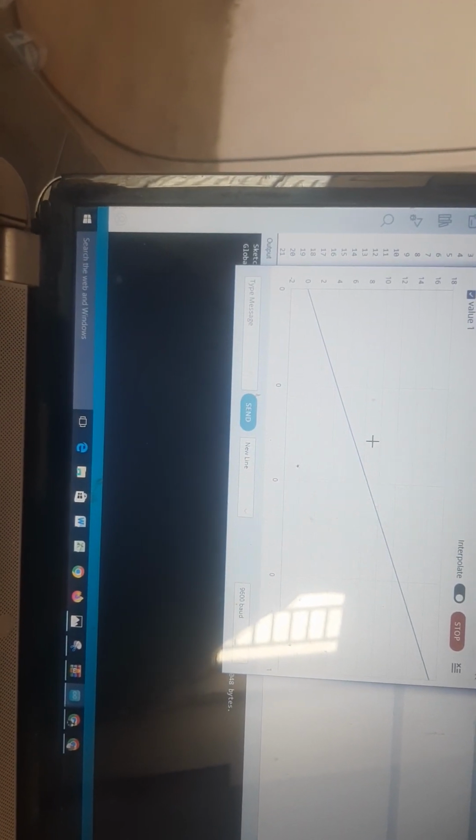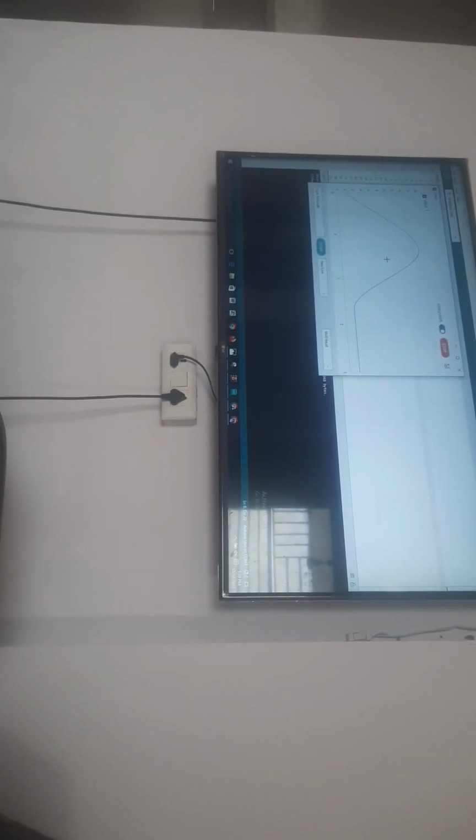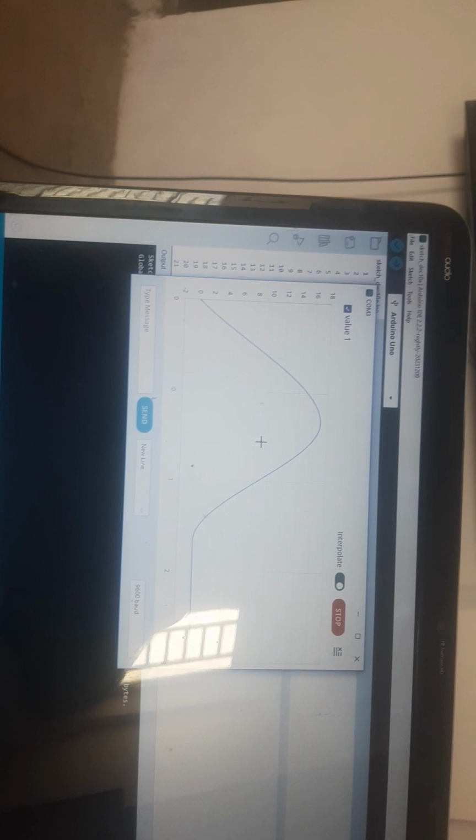So the data is interpolate, and then if I... okay, so now we can see that the data has been generated, and this is one point, but if I remove it, we get another point. So I'm feeding the opaque substance or translucent substance in between, and the graph is generated accordingly, as you can see over here. Maybe I put too much time over here, so let me stop this and do it once again.